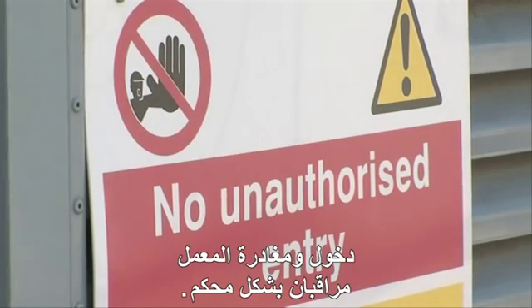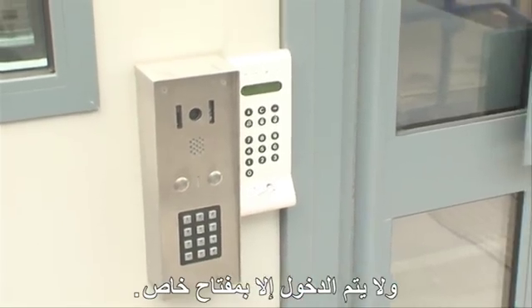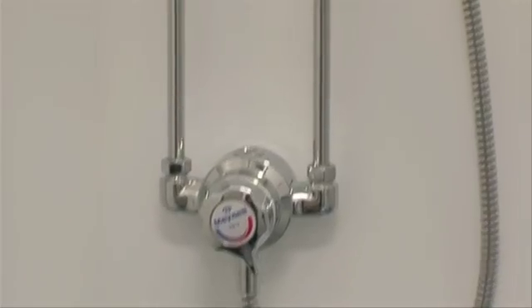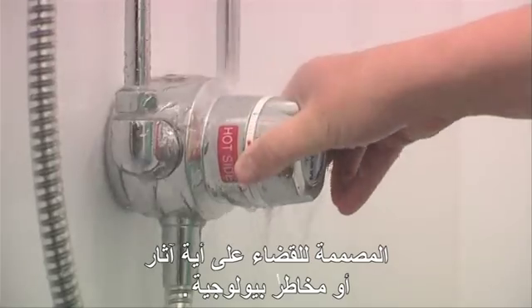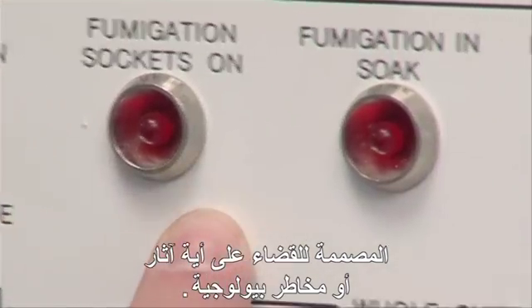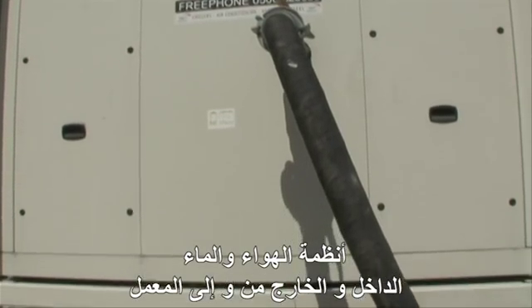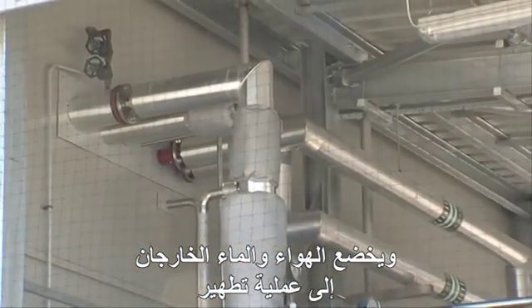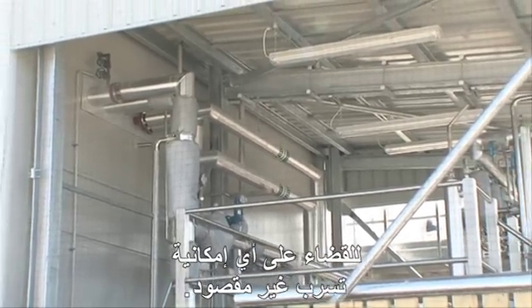Entry to and exit from the lab is strictly controlled. Access is key activated. Any person entering the lab must be authorised and security cleared. The entry and exit antechambers provide showers and other safety precautions designed to destroy all traces of any biohazard. The air and water systems going into and out of the lab are strictly controlled. Outgoing water and air undergo decontamination procedures to eliminate any possibility of an accidental release.